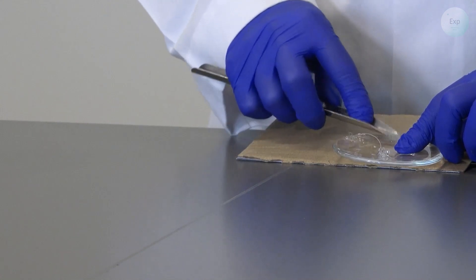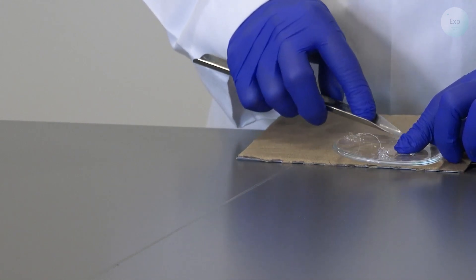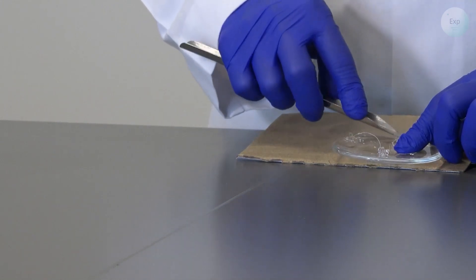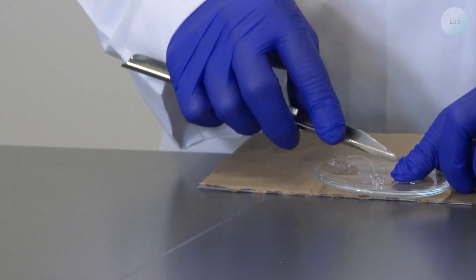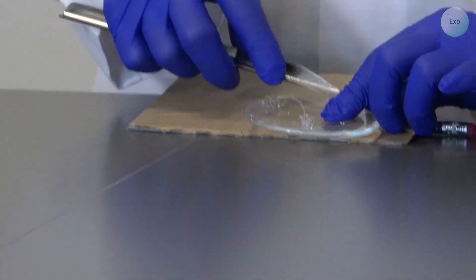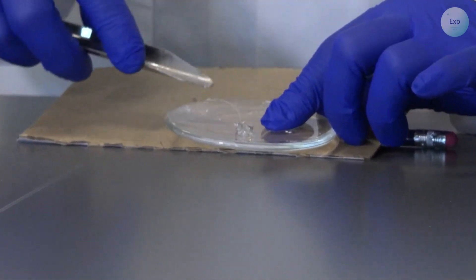If there is some resistance, we just need to press a little harder. But when we do the scraping, you need to be very careful not to accidentally break the thread, because then you have to begin again with the tying of the crystals.